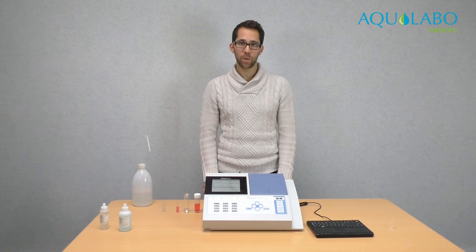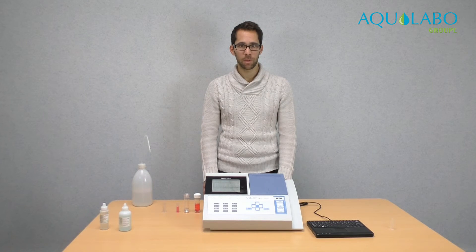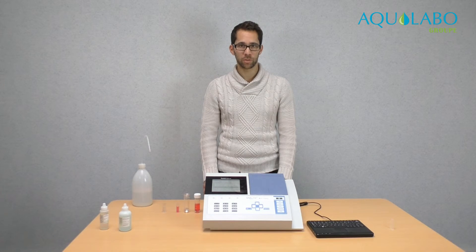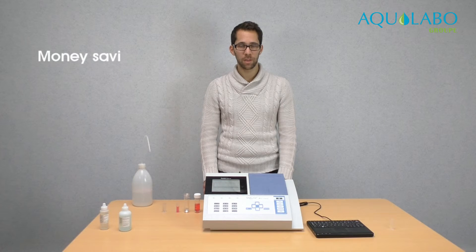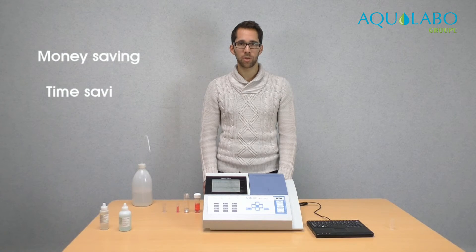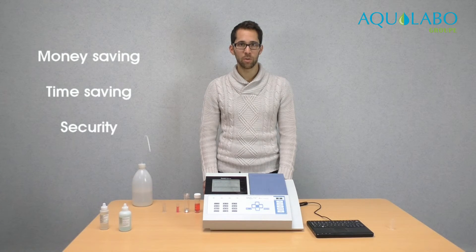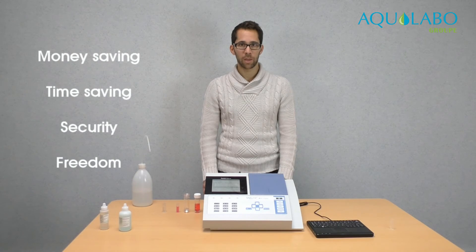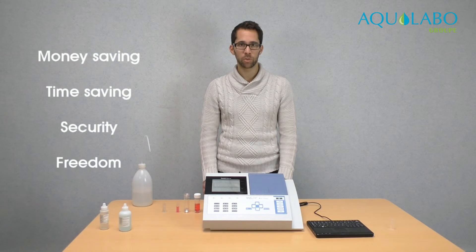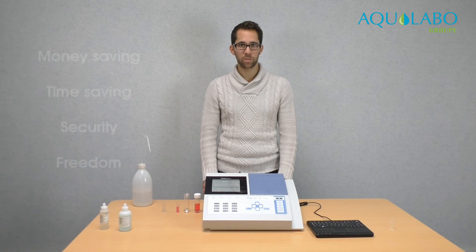So we have a method that gives the result in less time without the use of chemical reagents, which means earning money, saving time, but also more security because there is no use of dangerous products. And also more freedom because you can conduct more analyses without additional cost.